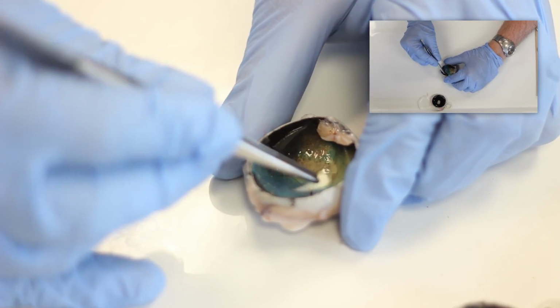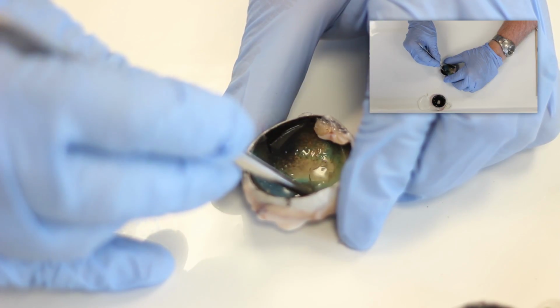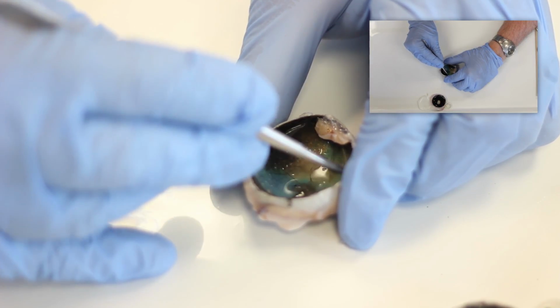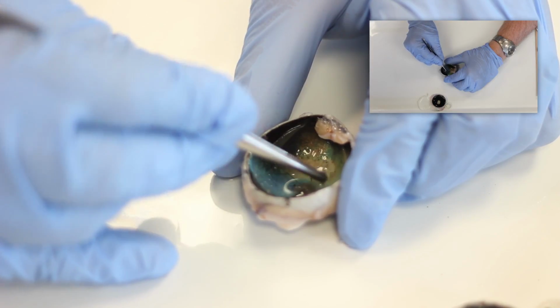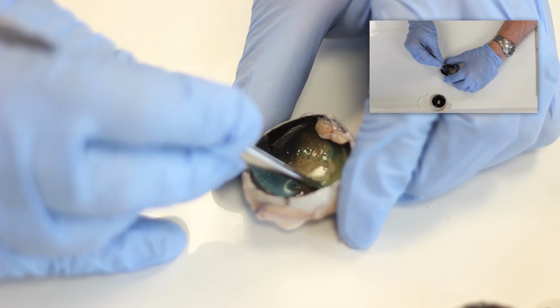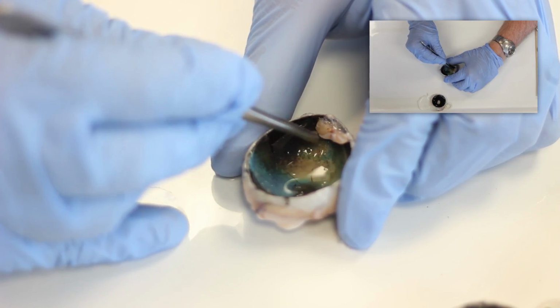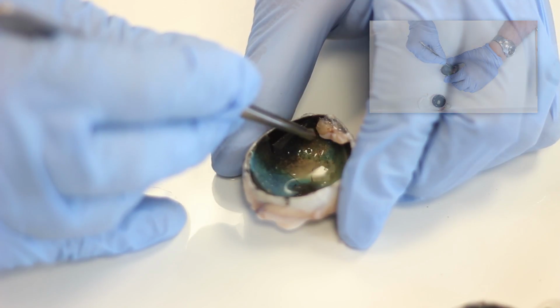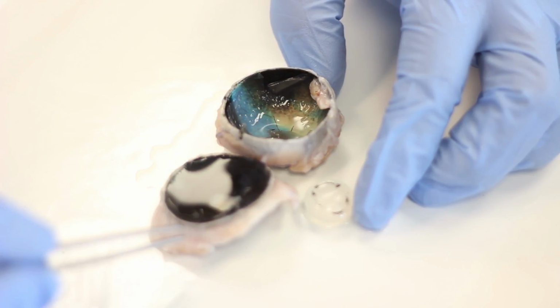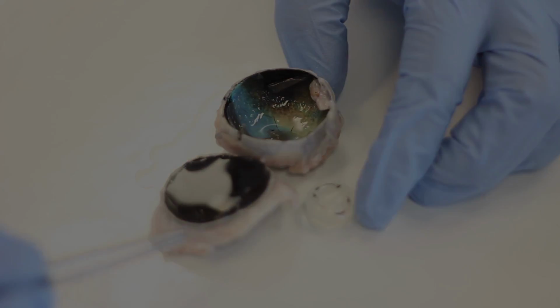In this eye, unlike the human eye, you're able to see that the choroid pigmented layer is divided into a light absorptive black area along the horizon, as well as a shiny green pigmented layer which is reflective. This is called the tapetum and reflects light back into the eye of animals who are usually active during the night. So now you should be prepared to do a dissection of the eye and reveal both the exterior and interior features of the eyeball that allow us to be able to see.